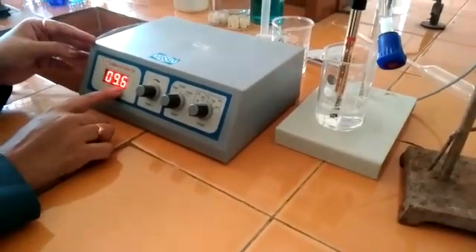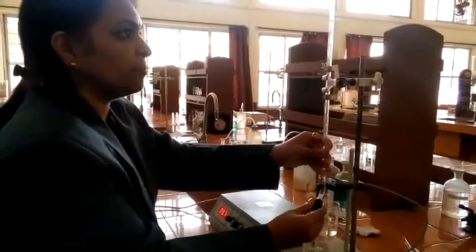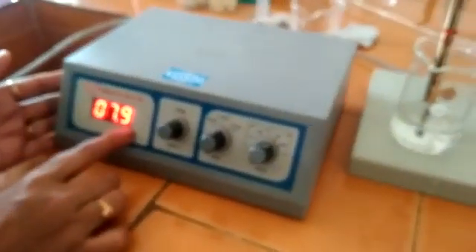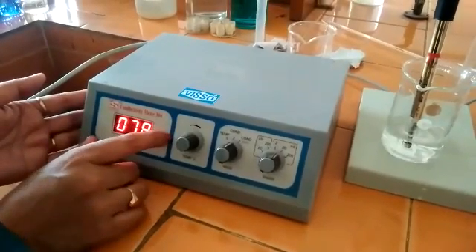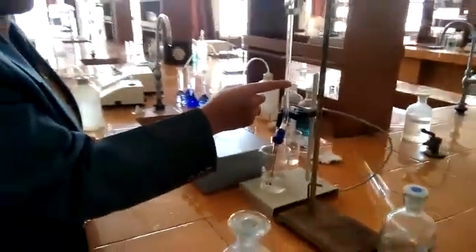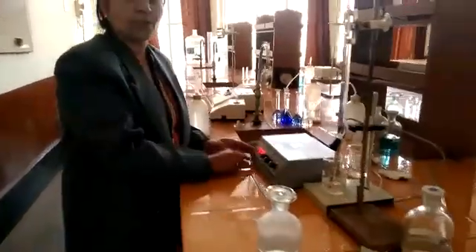This is the initial conductivity of the solution. After that, you have to add 0.5 ml of NaOH solution from the microburette each time, shake it well, and note whatever change in conductivity occurs. The conductivity of the solution decreases, indicating a decrease in H⁺ concentration. Continue adding NaOH up to 10 ml, recording the conductivity at each 0.5 ml interval.